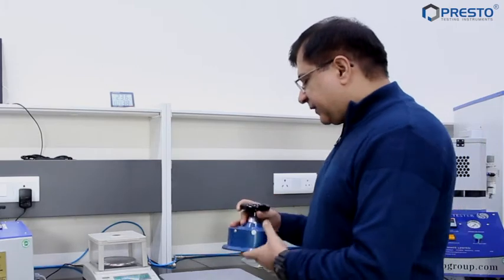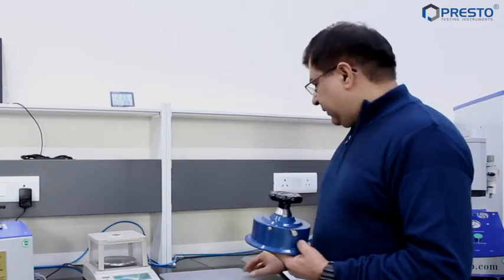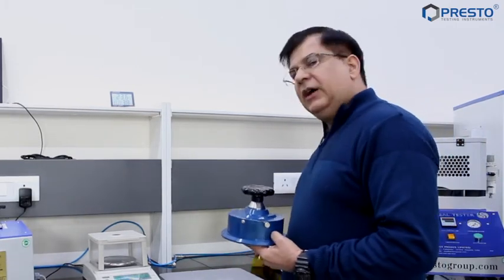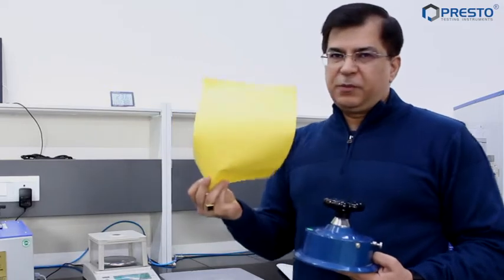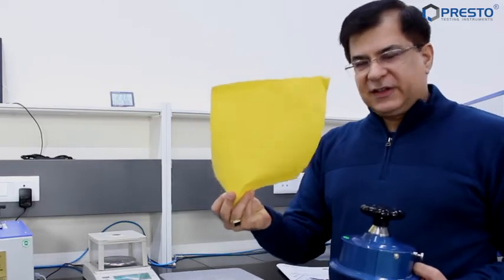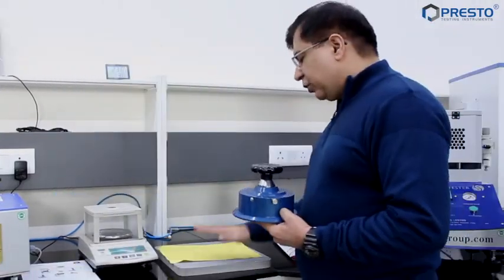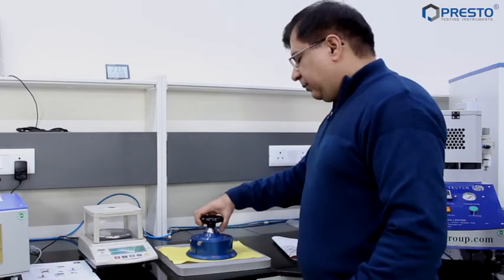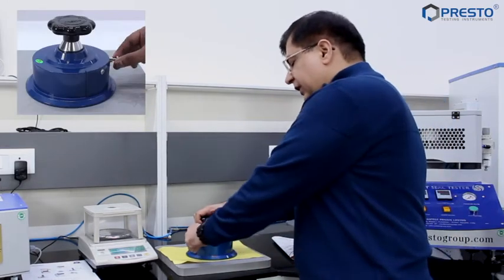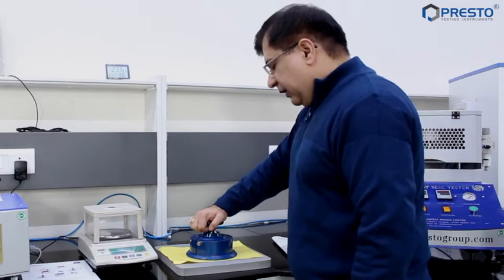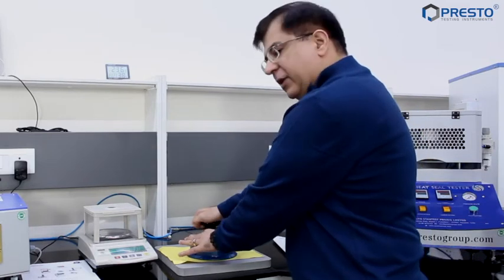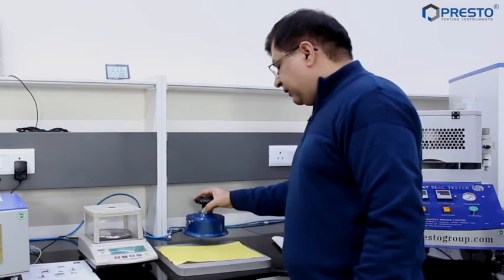This is a rubber mat I have for the sample taking. I have got this yellow piece of paper so that you can see it very well. Here I put the sample, put the cutter on top of it, release the lock, and with a simple twist of my hand I can get a round cut as simple as that.